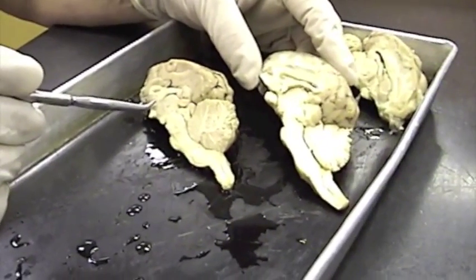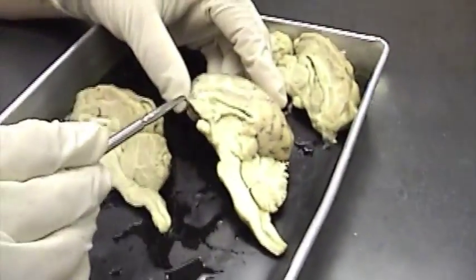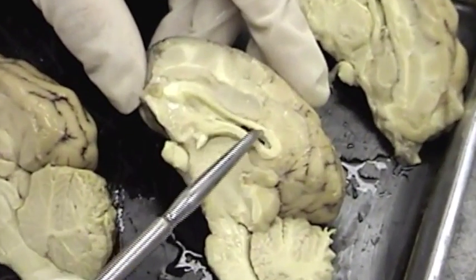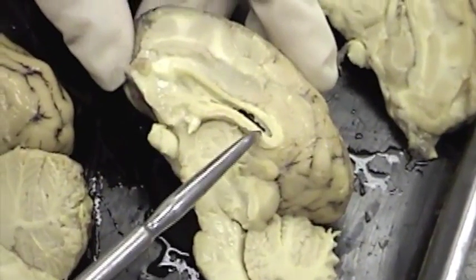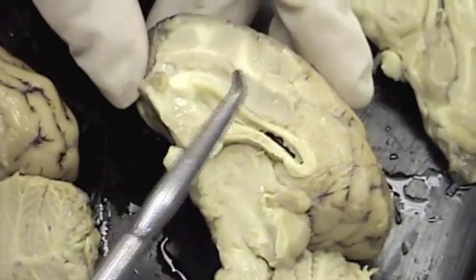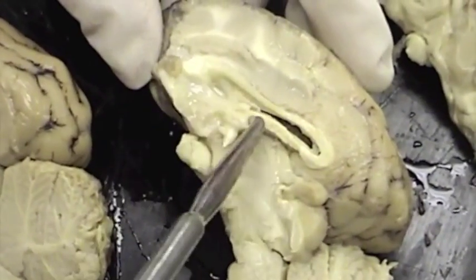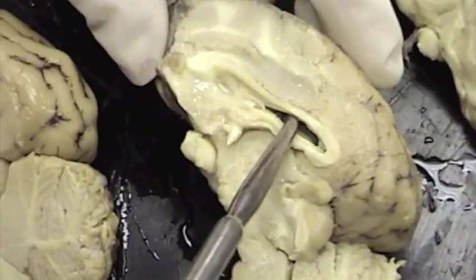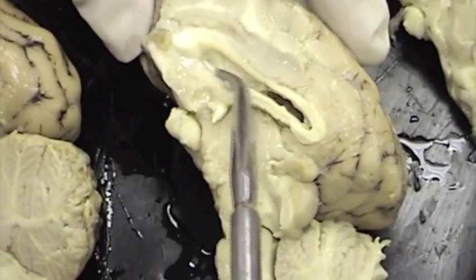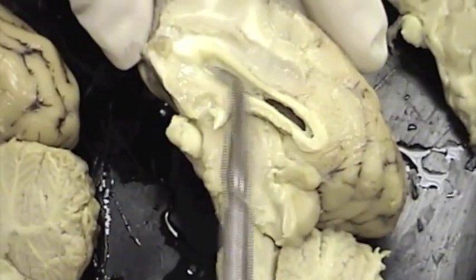On a brain that has been cut along the mid-sagittal section, we find some further structures. Here we have the corpus callosum, which forms the roof of the lateral ventricle. Here we have the fornix, which forms the floor of the lateral ventricle. I can put my probe into the lateral ventricle right here. On this particular brain you can see a small amount of septum pellucidum right there, dividing the two lateral ventricles.